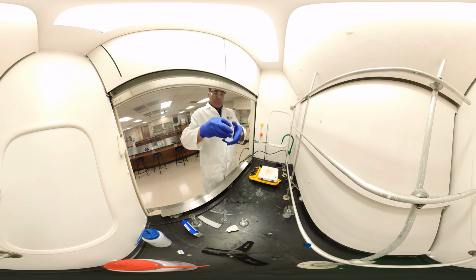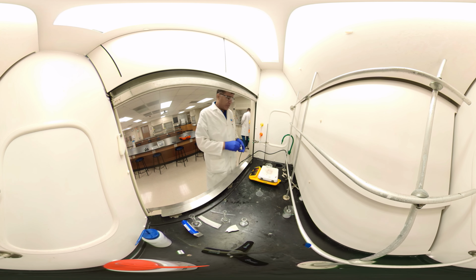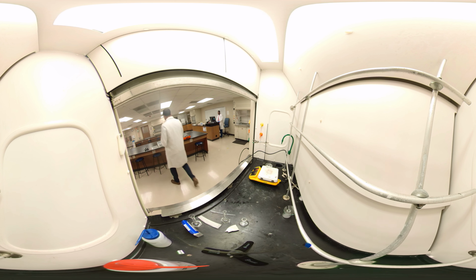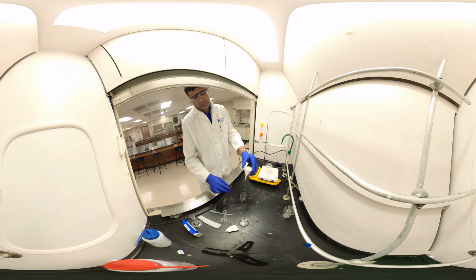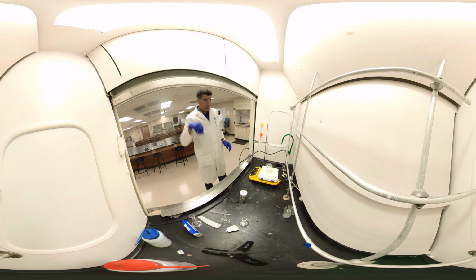Always label it. See, I warmed up this one. I think we need to rinse a little bit more. I see some solid, and most of the solid is gone, which means acetaminophen dissolved, binder is still there. Okay, and I'll do another filtration into another beaker. For filtration, you can use a stand and everything, but since I'm using the small funnel, it's holding there. But that's not the best way to do it.